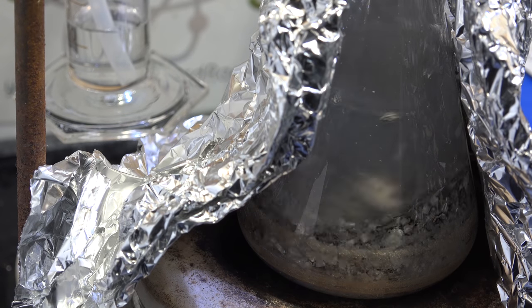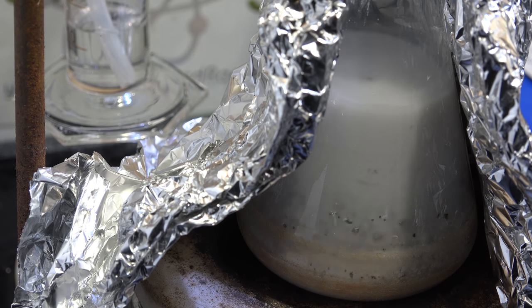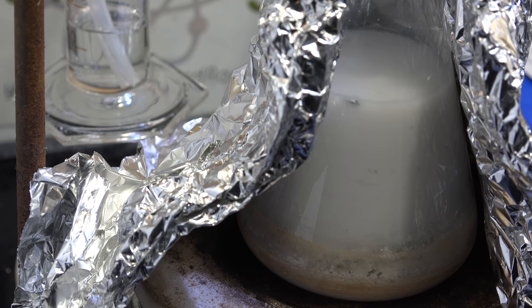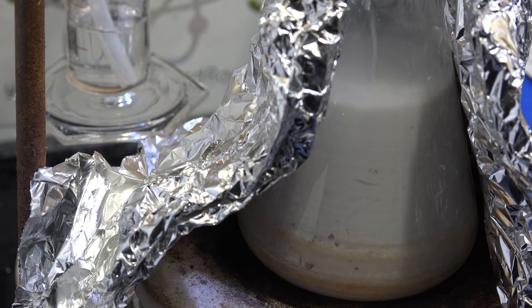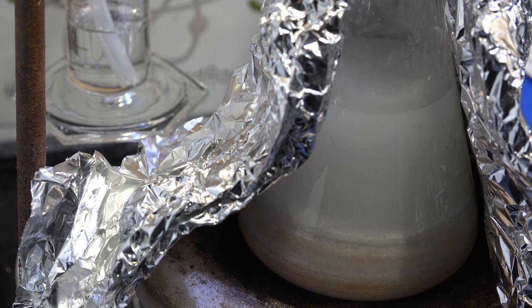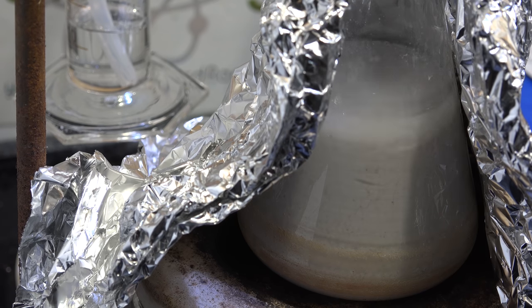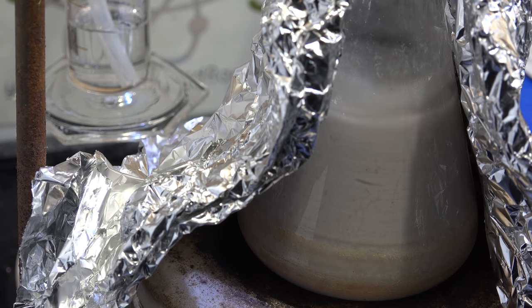Greetings fellow nerds. Doing another lab notes video on my project on making sodium metal. As you already know by now I've been making sodium metal by the alcohol catalyzed magnesium reduction process and have been very successful so far.